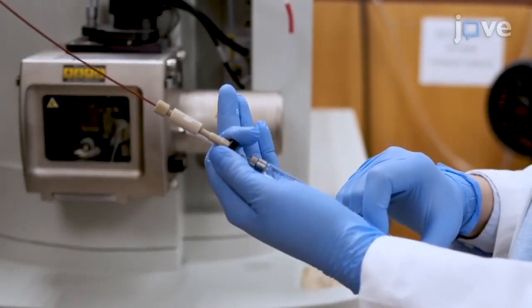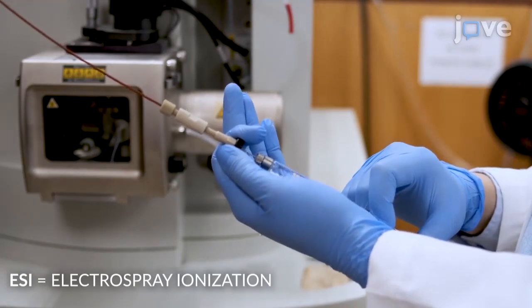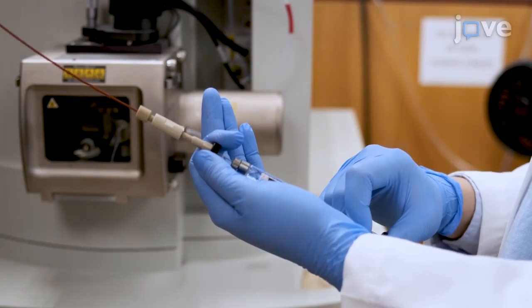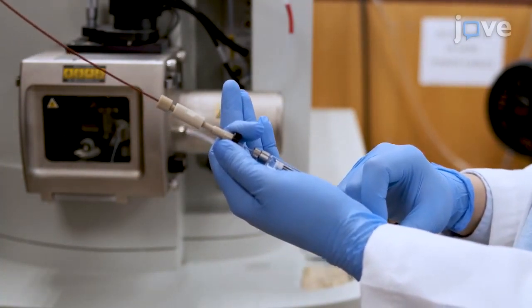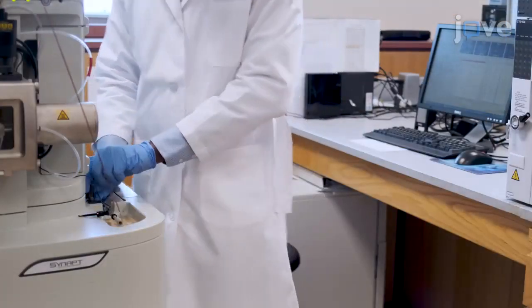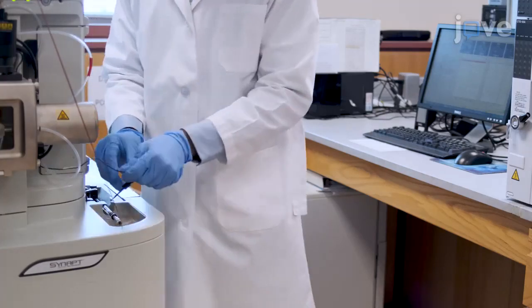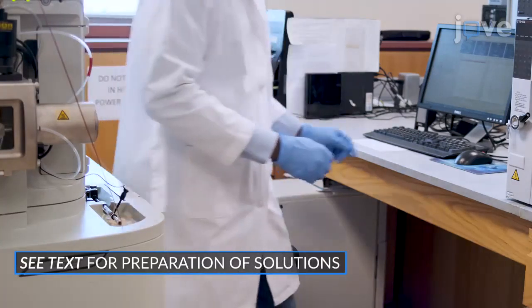To begin, clean the ESI entrance tubing and needle capillary thoroughly with about 500 microliters of 0.1 molar glacial acetic acid, 0.1 molar ammonium hydroxide, and finally, deionized water. Use native ESI IMMS conditions as described in the text protocol to collect the negative and positive ion IMMS spectra of the 10 ppm poly-D-L-alanine solution for 10 minutes each.